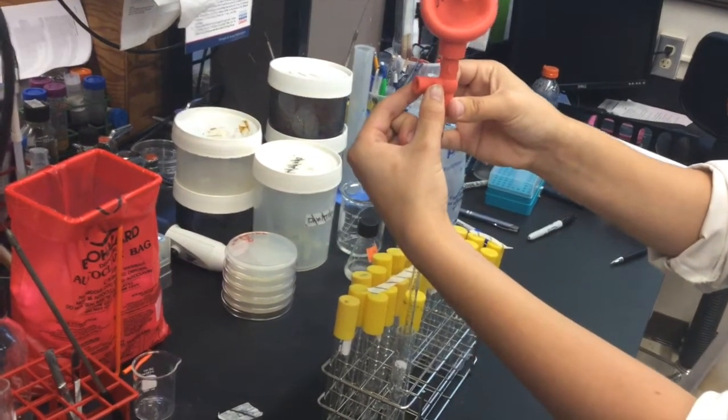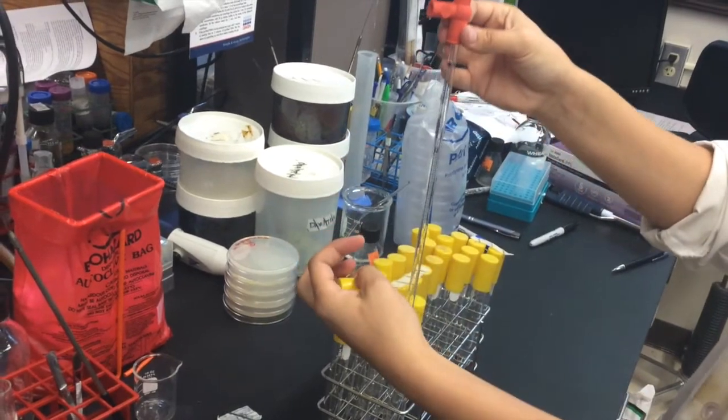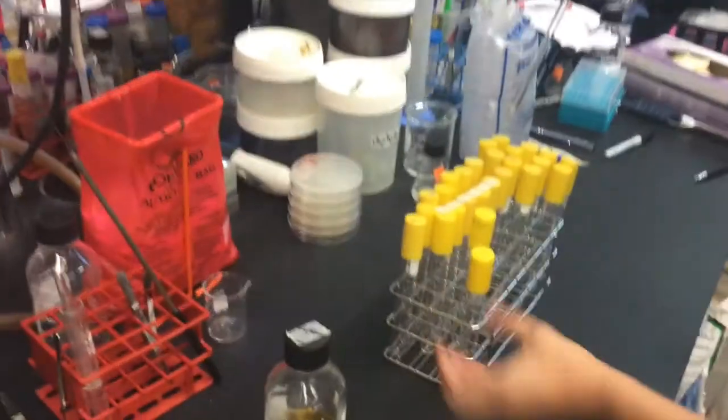Once you have expelled the liquid into the tube, move it away from the rest of your tubes so that you know you have already completed it.